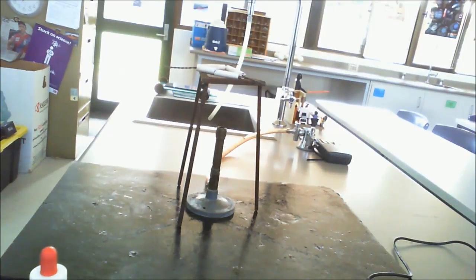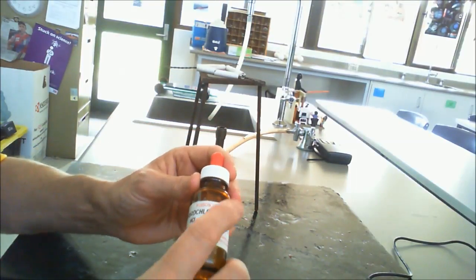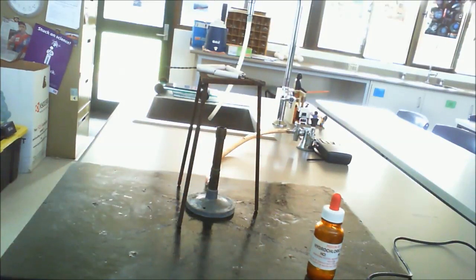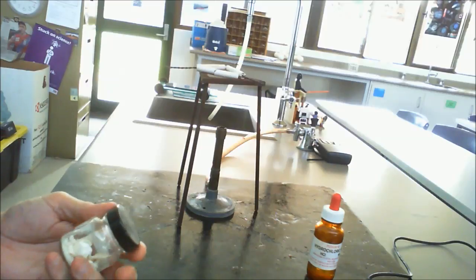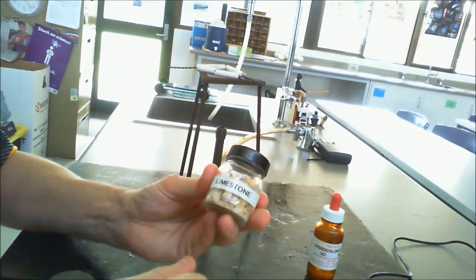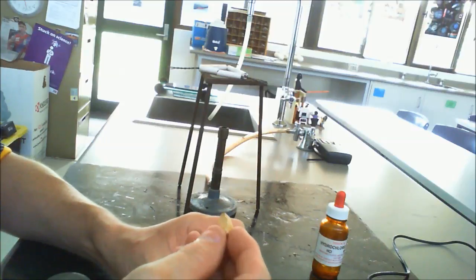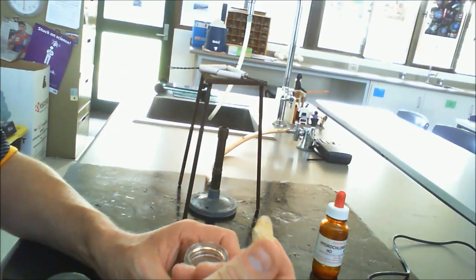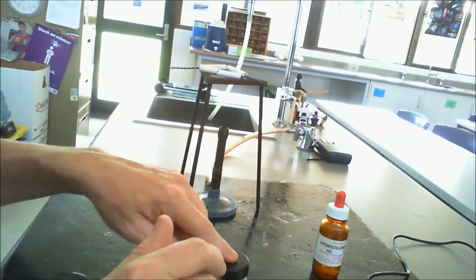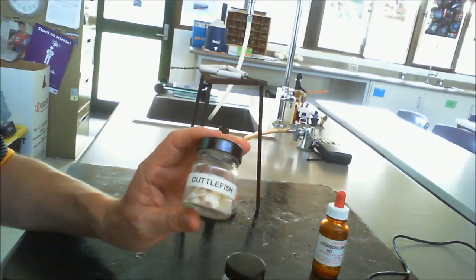Okay, now with an acid carbonate reaction, we're going to be using once again our good old friend hydrochloric acid, and in this case we're going to be using the 1 molar hydrochloric acid, but we're also going to be using a group of chemicals that we call carbonates. Now, carbonates are found in all different areas, and we find them, for example, in limestone. So limestone walls and limestone that you collect from the ground will contain some carbonates, and it's calcium carbonate in that regard.